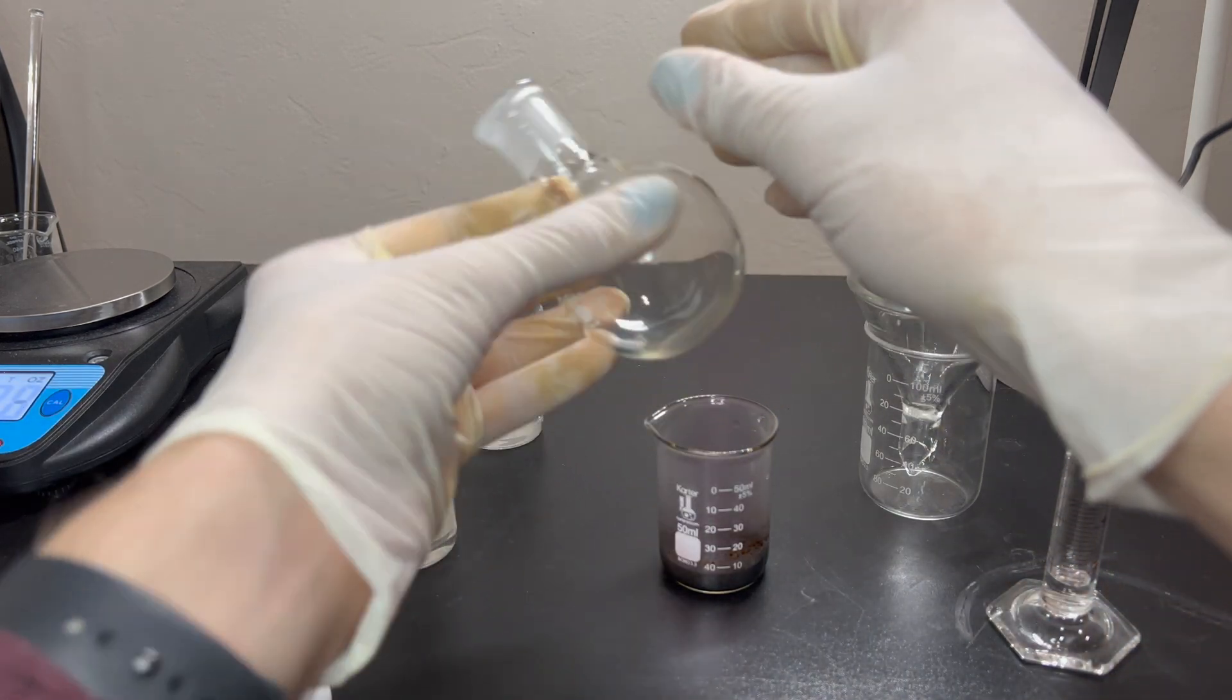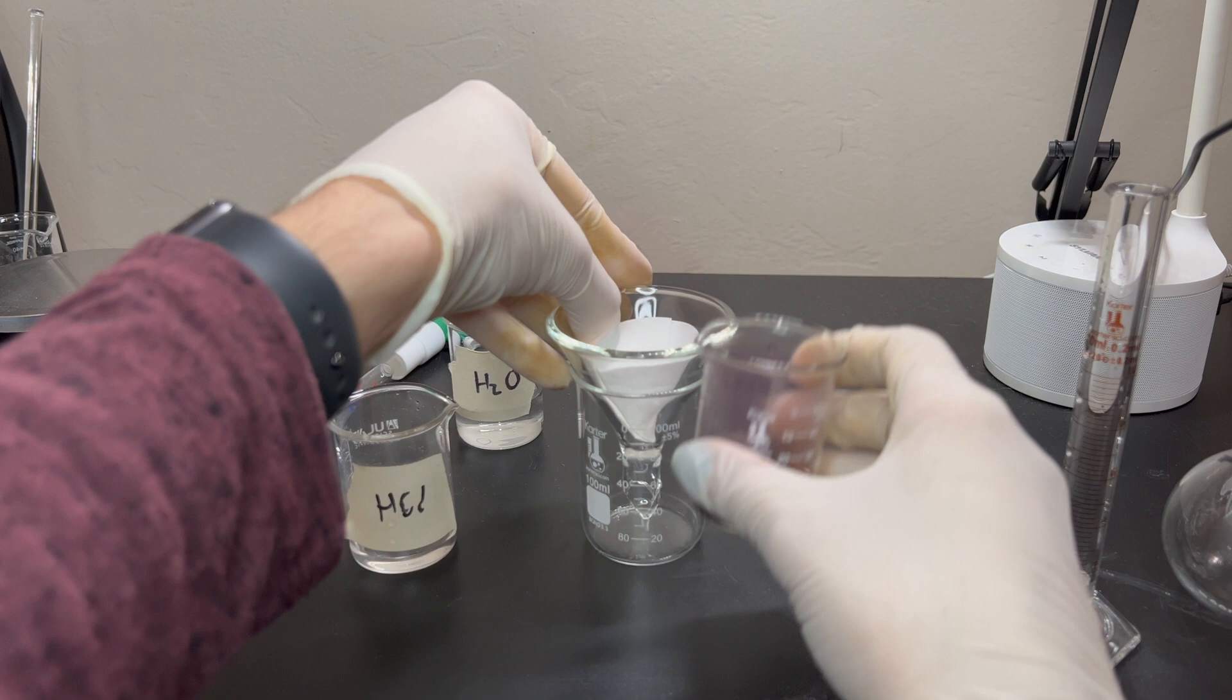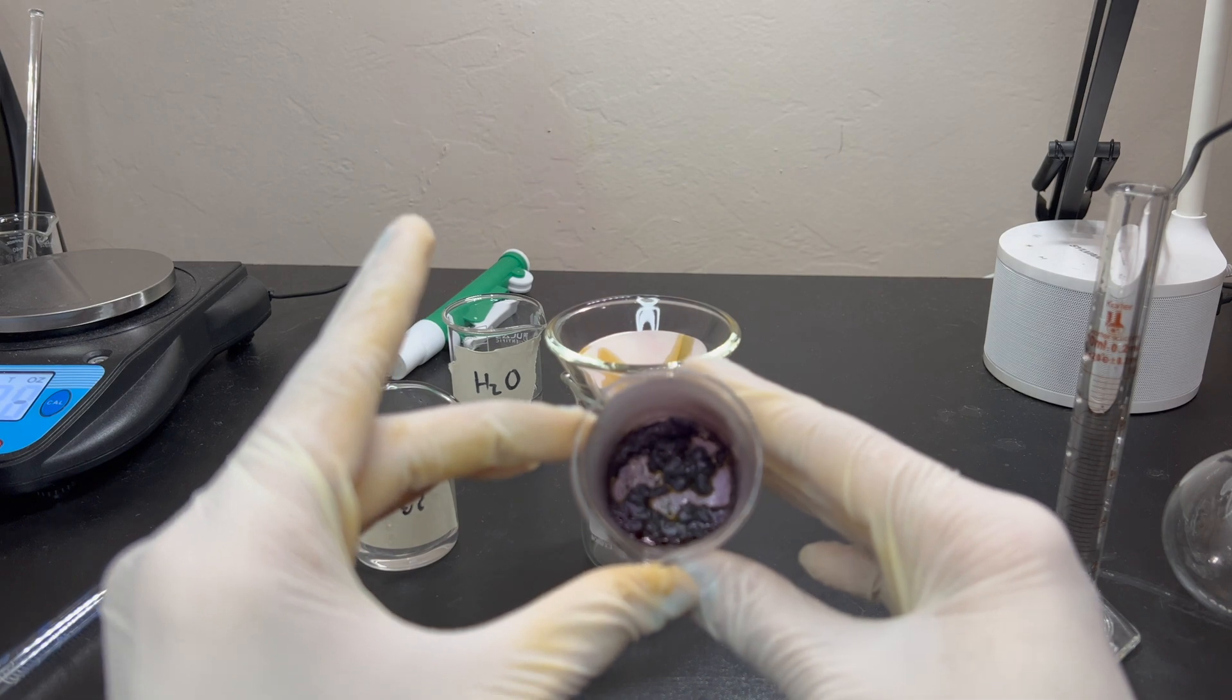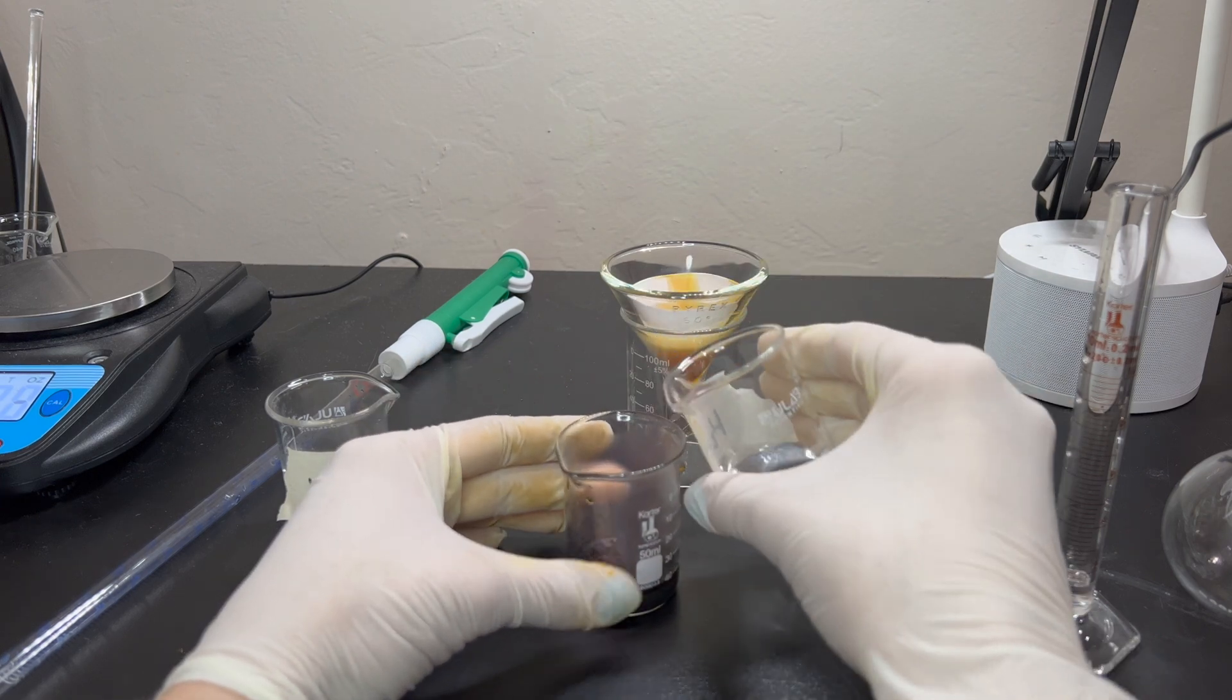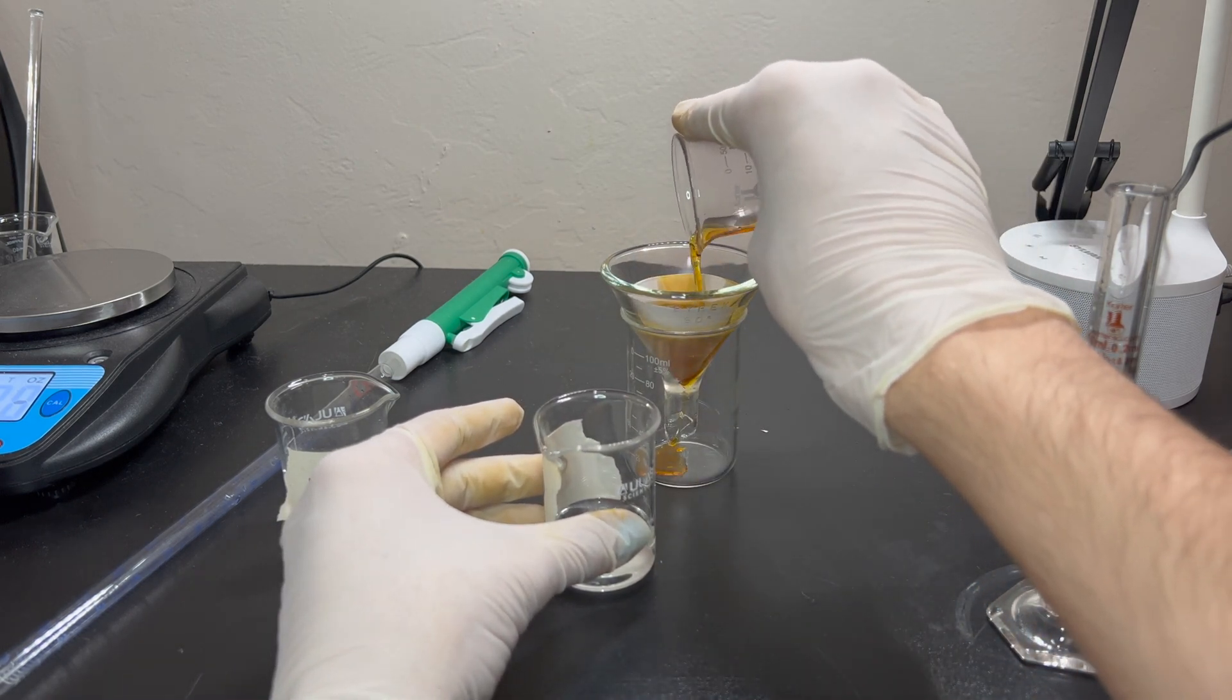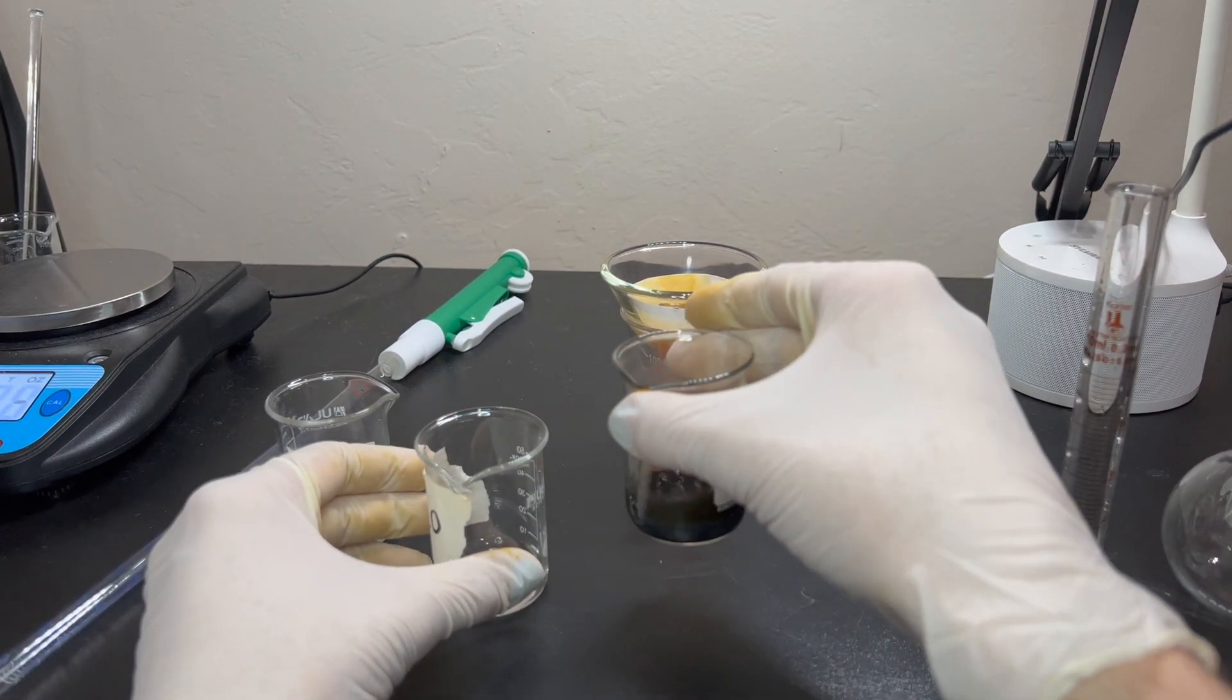Okay. So, once it's cooled down, you can go ahead and take this off. Be careful with that, because it has iodine. Iodine is poisonous. Do not do this unless you know what you're doing. Okay. So, go ahead and put that in there. And then slowly pour. And make sure to do this with gloves. You do not want to get this stuff on your hands. It will stain you for weeks, if not months. Now you can see you have chunks of iodine in there, which is not fun. You can see it spewing out towards the camera. Which is fun. So, what I'm going to do is just pour water in there. Allow it to not dissolve, but just precipitate into it a little bit. And then you can go ahead and pour it in. And you just kind of keep doing this, allowing it to filter out onto that paper. And you'll be left with clumps in here left.